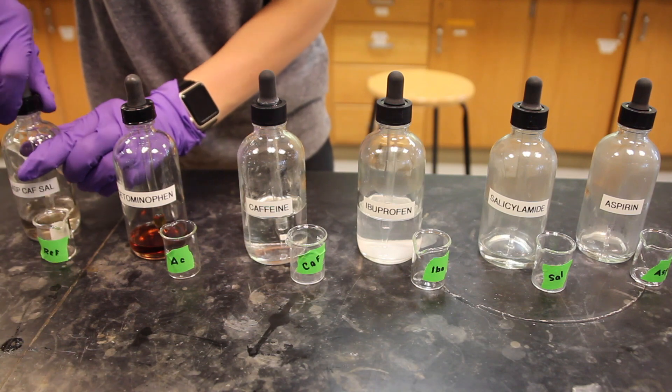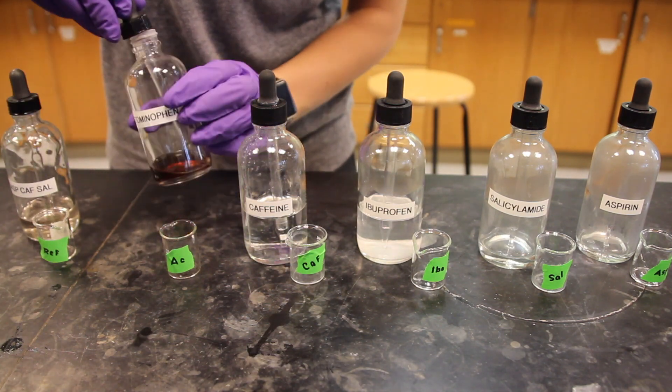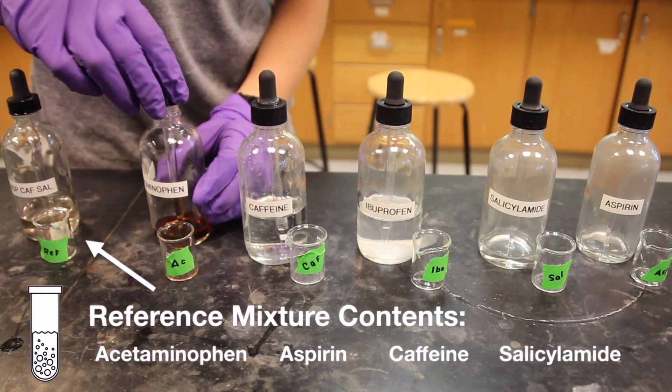Solutions of all of the known reference compounds have already been prepared for you in the lab. There is also a solution containing a mixture of 4 compounds: acetaminophen, aspirin, caffeine, and salicylamide.